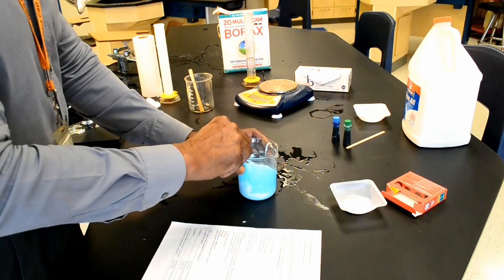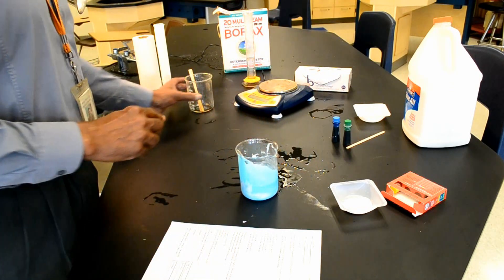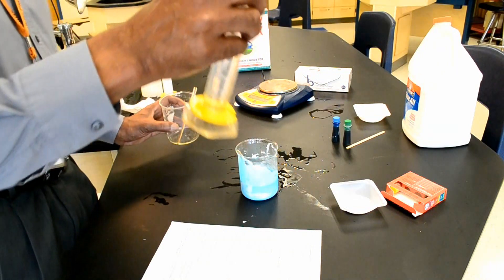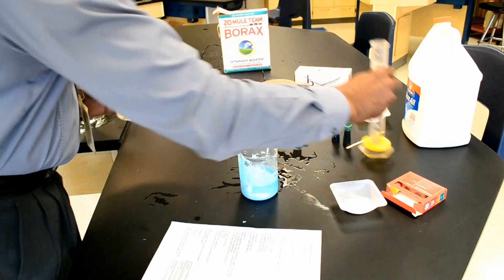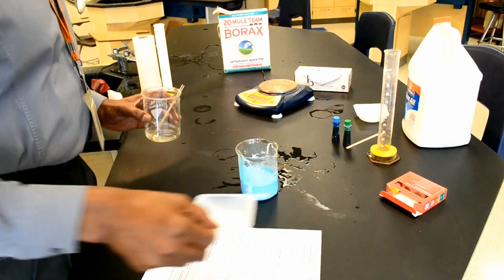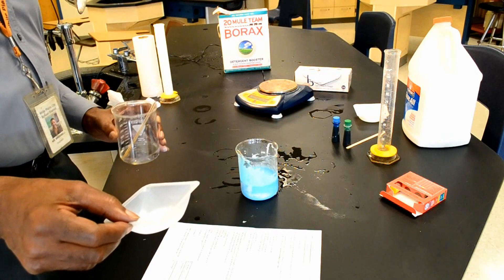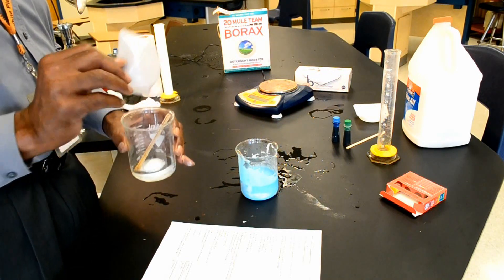Now to my second beaker, I'm going to add 45 milliliters of water and 5 grams of sodium borate, also known as borax.